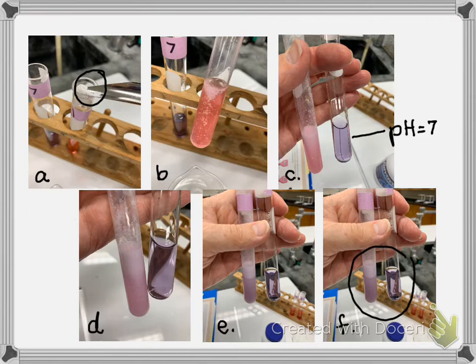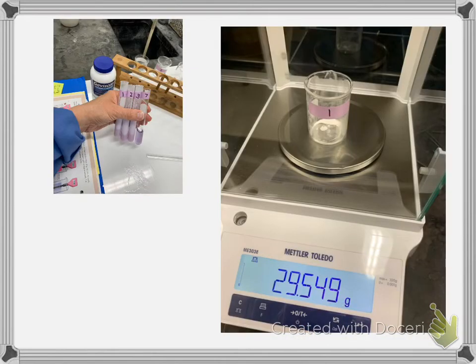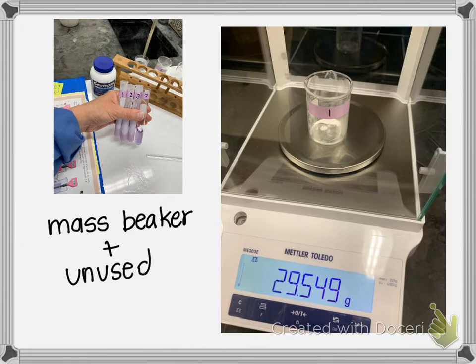So what I did was I repeated the process of adding the antacid until the pH appeared to be neutral. And then I reweighed the beaker, and here you can see I did 3 trials. You can see I used quite a bit of it. And so this is the mass of the beaker plus the unused sample. And then you need to record this, because that's a part of your data.